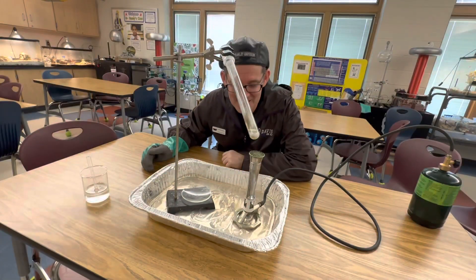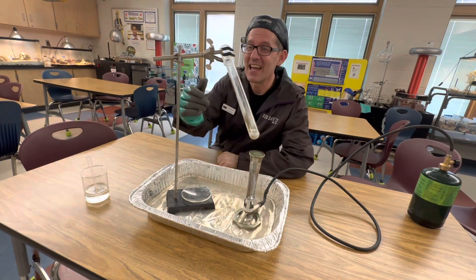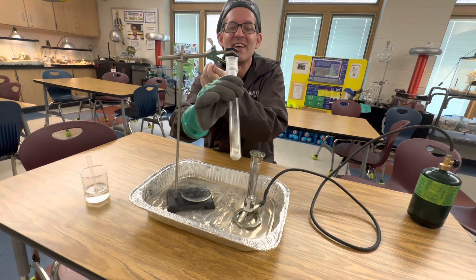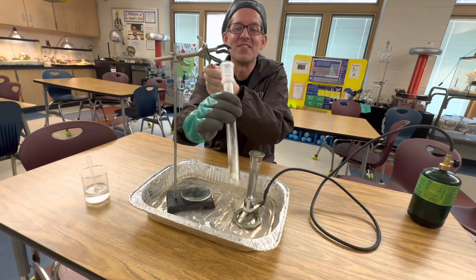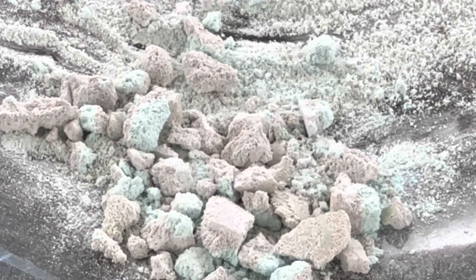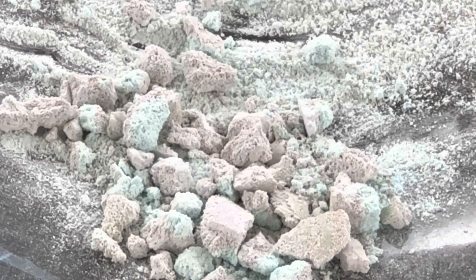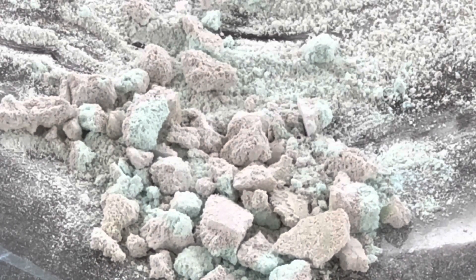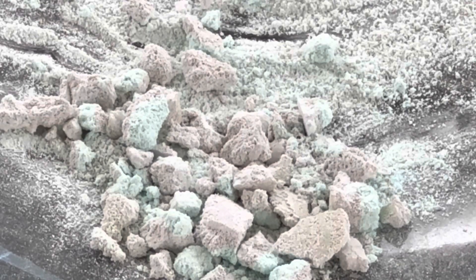You can start to see a lot of condensation forming in the test tube as it becomes anhydrous copper sulfate. The next step is to carefully take your anhydrous copper sulfate and tap it into a watch glass where you can add a little water and rehydrate it into copper sulfate pentahydrate. You can see that it is so desperate for water molecules — it's absorbing water from the air and slowly turning blue again. Let's add a few drops of water to see what happens.